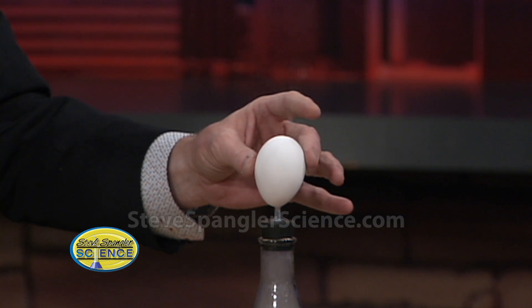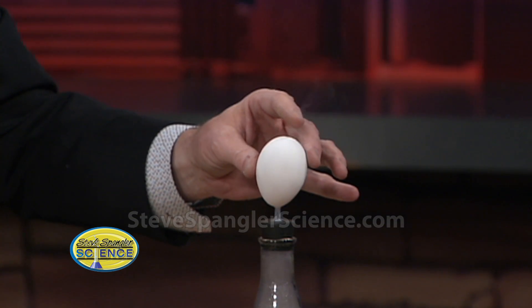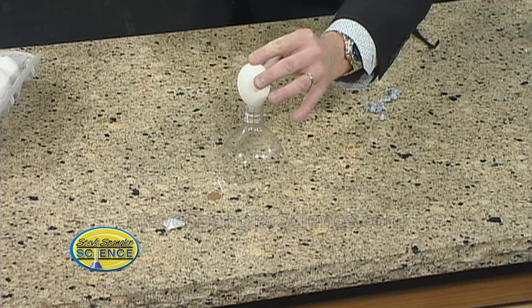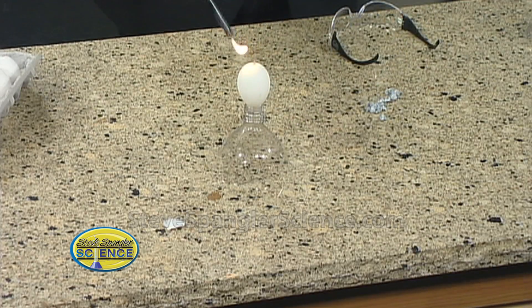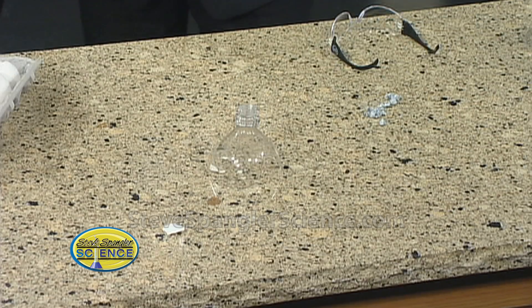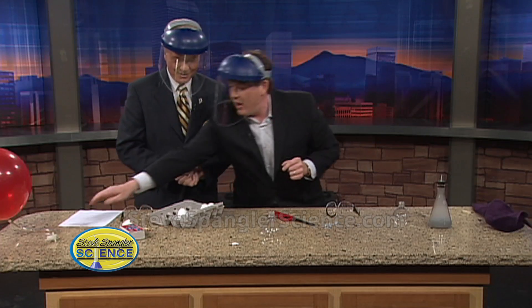How do you know when your egg is full? You don't. That's why, if I get it fuller, then it'll be great. That's what that red balloon is for. So if this goes over here like this — we could really fill it. I think that's a pretty good one there. Now, hydrogen is lighter than air, so it goes out. You see how it's starting to burn? I can see it, I don't know if they can see it on camera. That's a good one, don't you think? Do it again. That was really a good one.